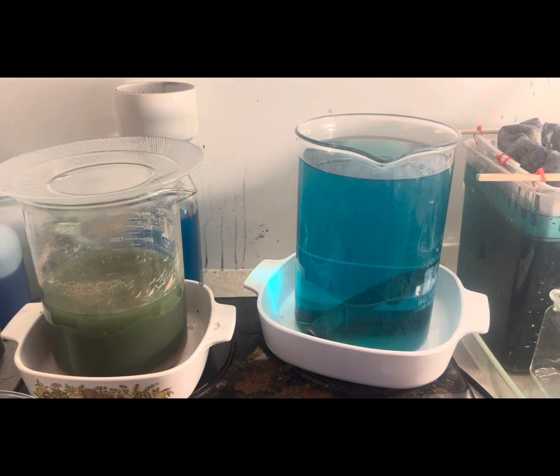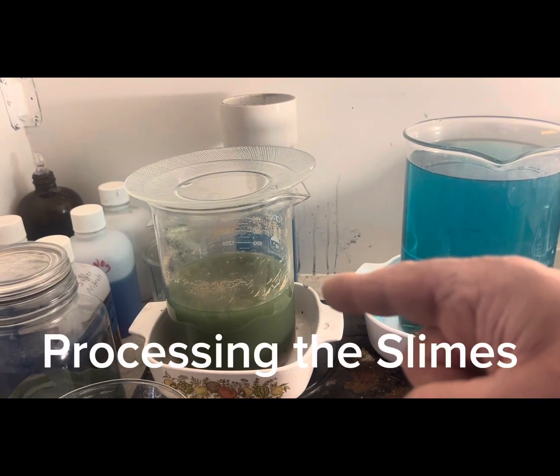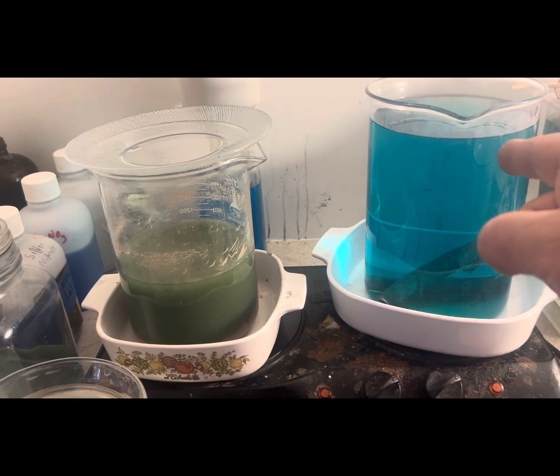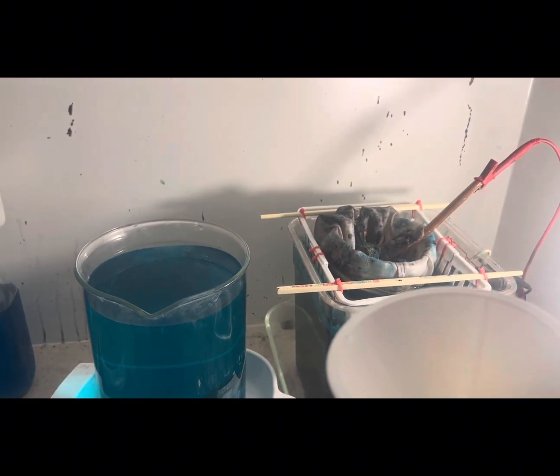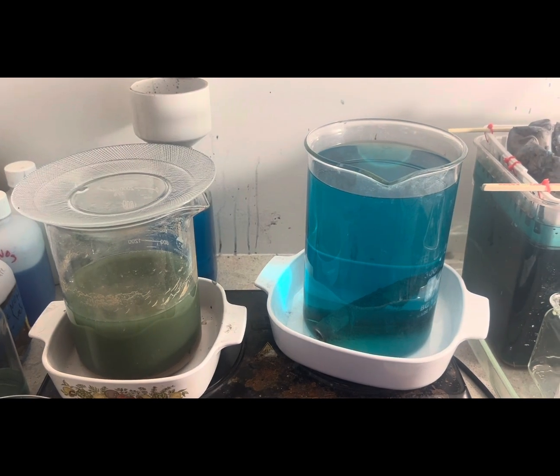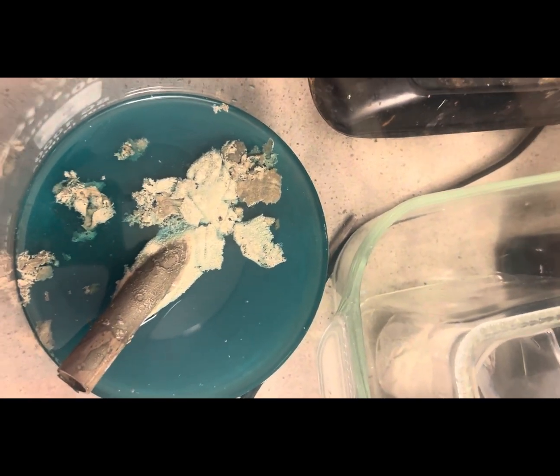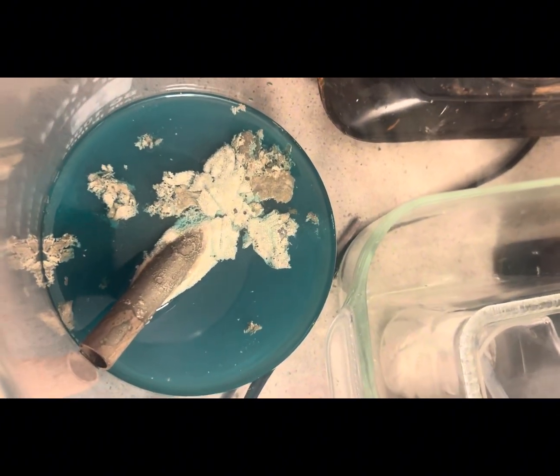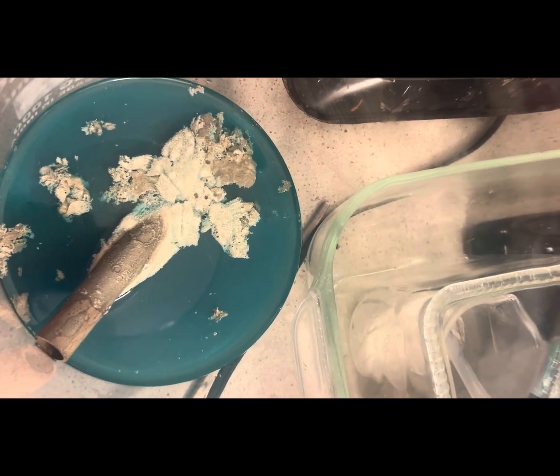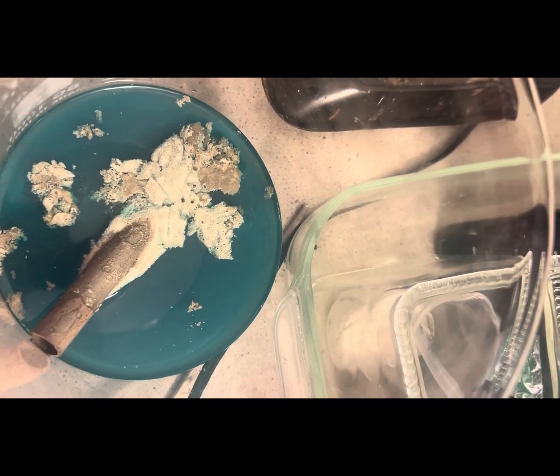I've come up with a plan — we're going to decant and filter. I need to recover the silver, so I'm going to pour this into here and filter into that. I've got some material to put in the silver salt to start it up. We won't waste time decanting — we'll go straight to the good stuff. This is the magic everyone loves to see: silver coming out of solution onto copper. This was from the slimes and I'm starting to decant the solution and cement it out on top of the pipe.